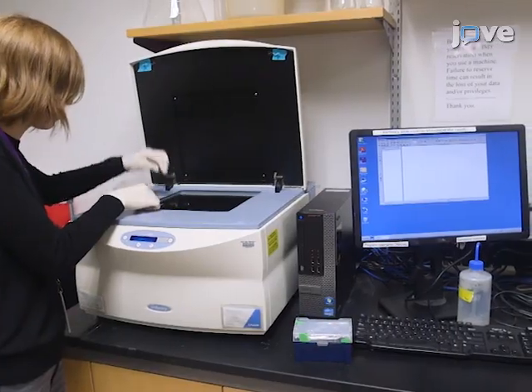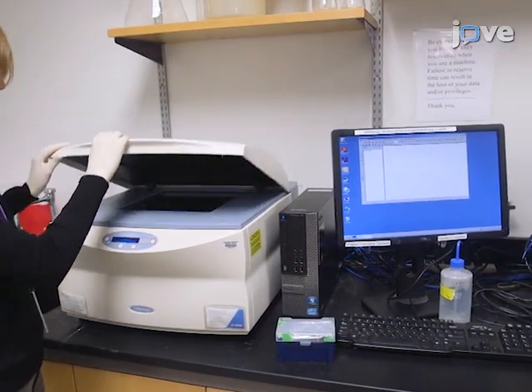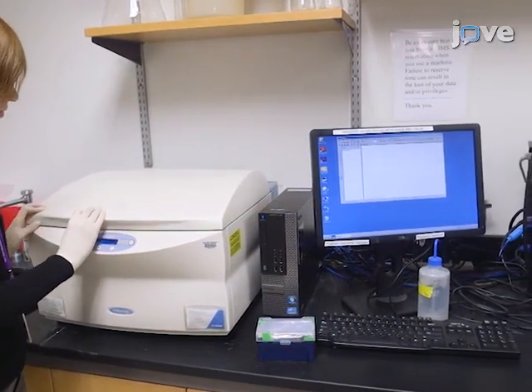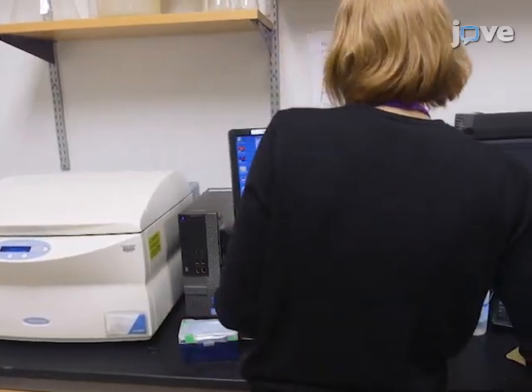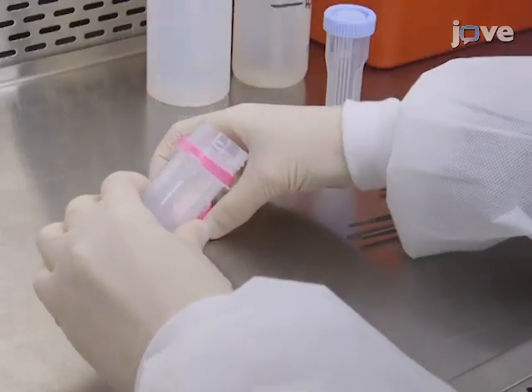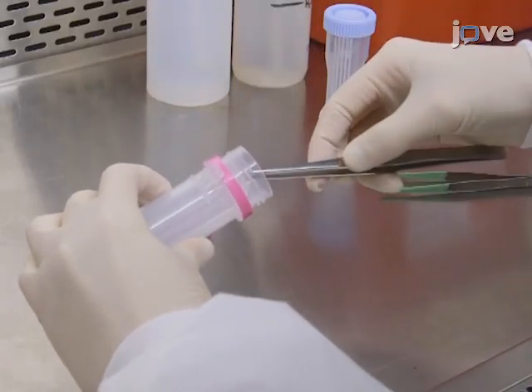After watching this video, you should have a good understanding of how to process a high-density peptide microarray. Once mastered, this technique can be done in 24 hours if it is performed properly. While attempting this procedure, it is important to remember to carefully handle the microarray to avoid scratching the microarray surface.